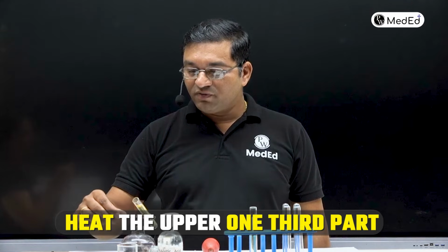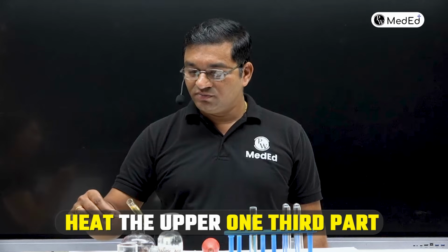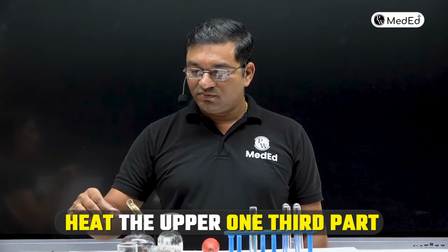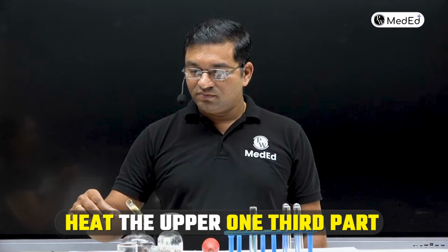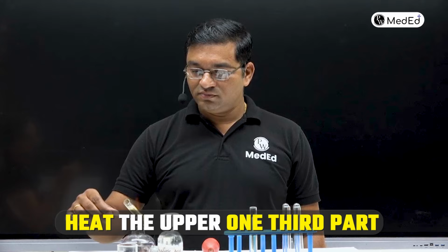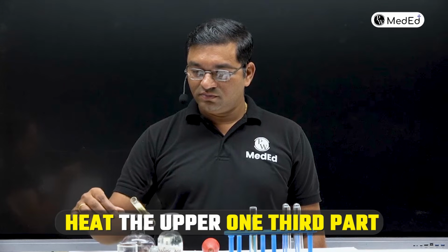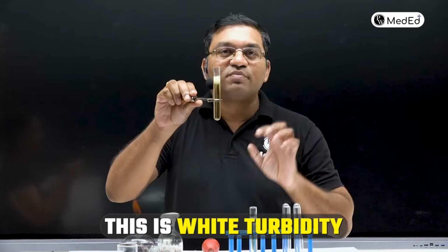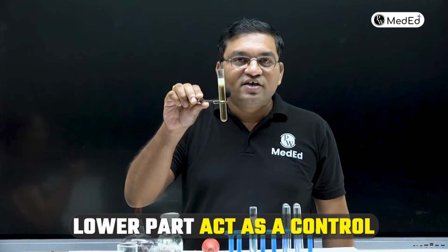Now heat the upper 1/3 part and observe the change. Now observe the change. This is white turbidity in the upper 1/3 part. Lower part of the test tube acts as a control.